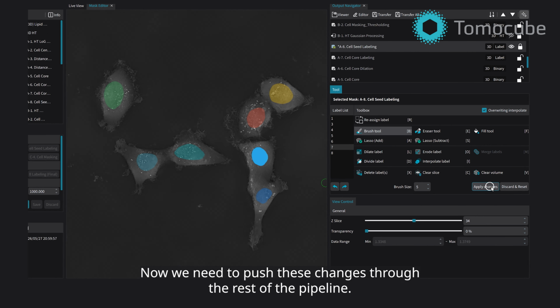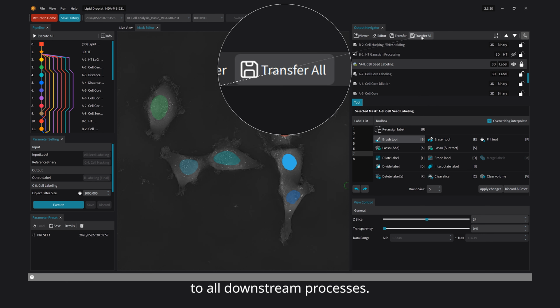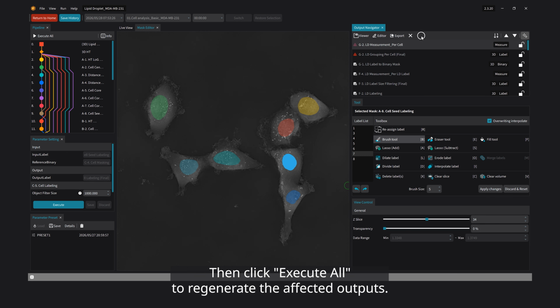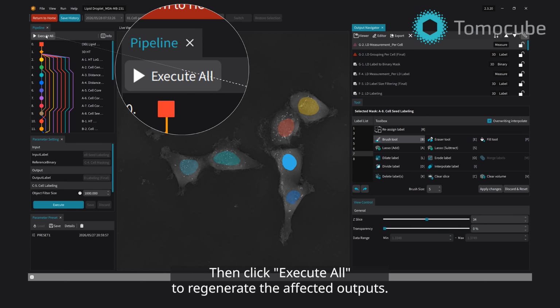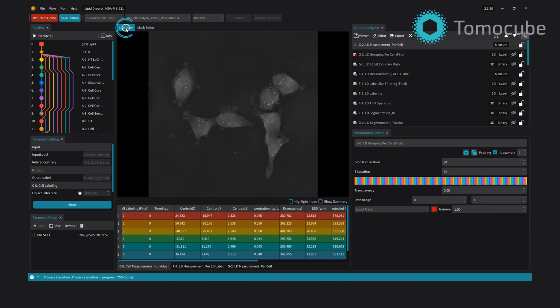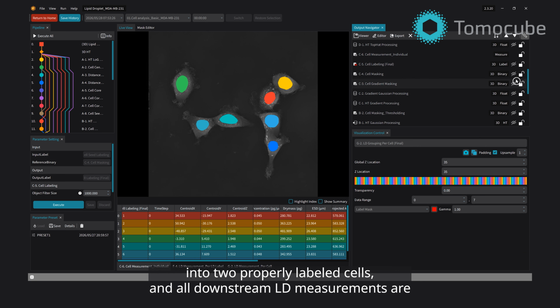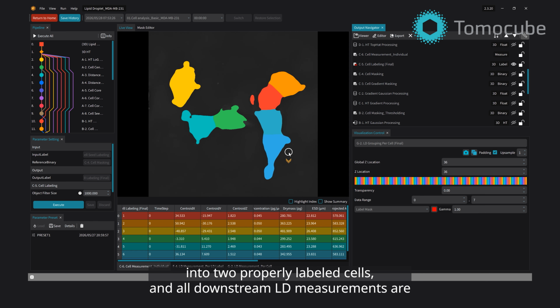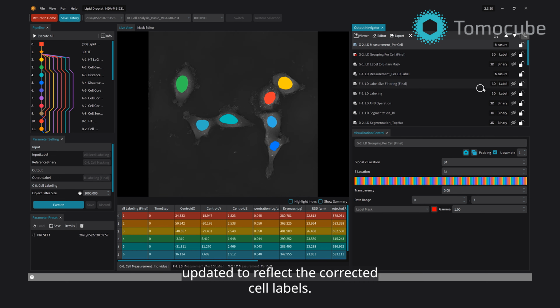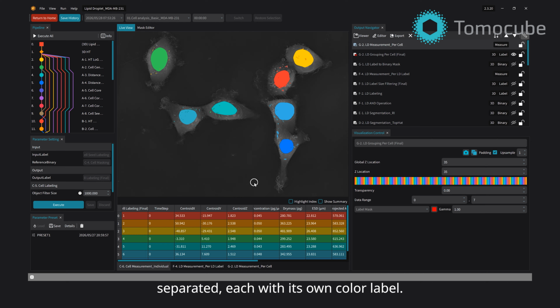Now we need to push these changes through the rest of the pipeline. Click Transfer All to apply the edited mask to all downstream processes. Then click Execute All to regenerate the affected outputs. Once it finishes, return to the live view. The pipeline has now expanded your two separated seeds into two properly labeled cells, and all downstream LD measurements are updated to reflect the corrected cell labels. Verify the result in the live view. The two cells should now be correctly separated, each with its own color label. The cell mask is fixed.